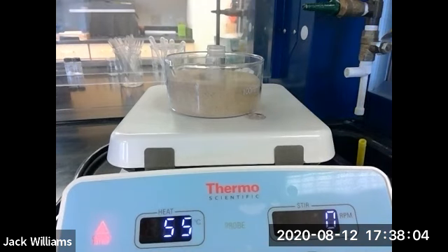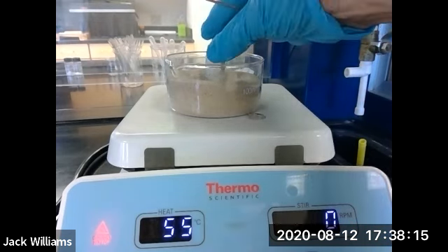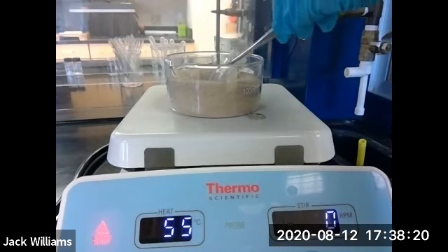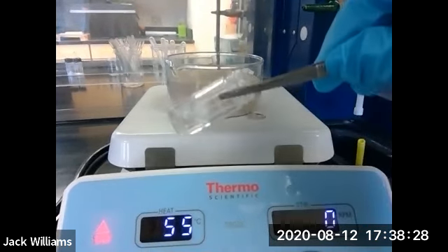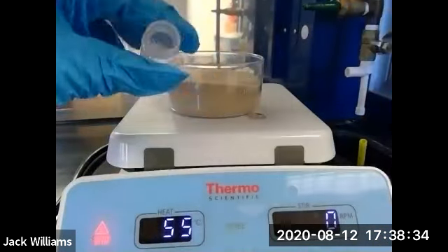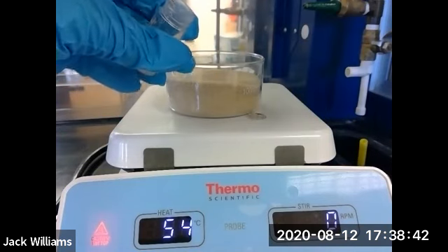Okay, folks, so we're back. This has been heating on the hot plate for a while. Let's see what it looks like. You want to get in the habit of handling things with tweezers. I mean, if I were to grab this, I know it's only 50 degrees, but what if it was 250 degrees, right? So kind of use a pair of tweezers, hold it carefully. You can see the benzoic acid on the sides. Now, if this were allowed to cool, then of course I could touch it. And you can see where it is in there. There's your benzoic acid.